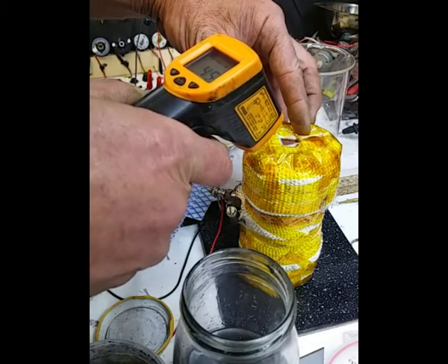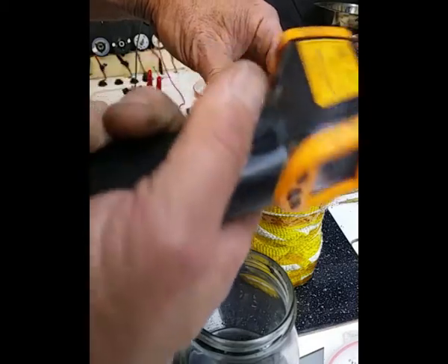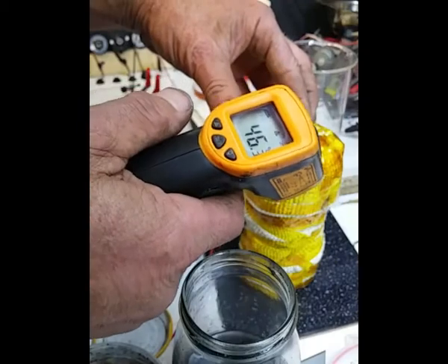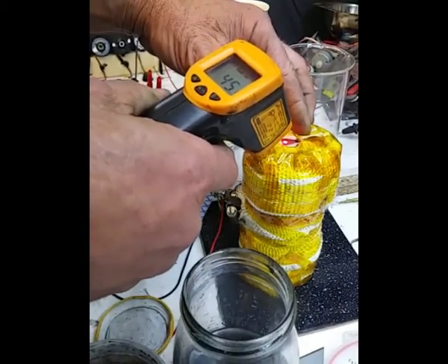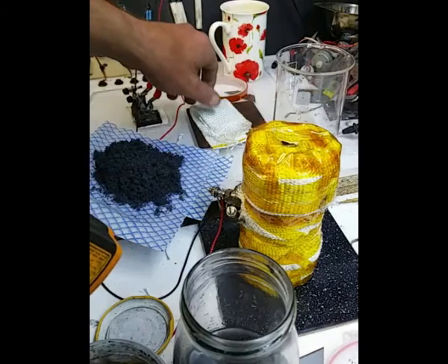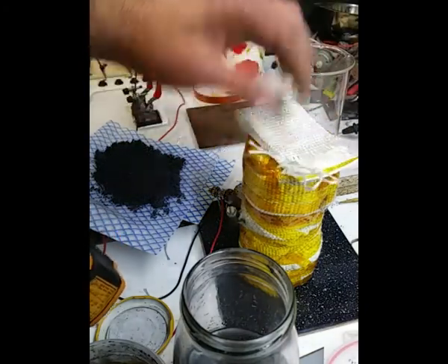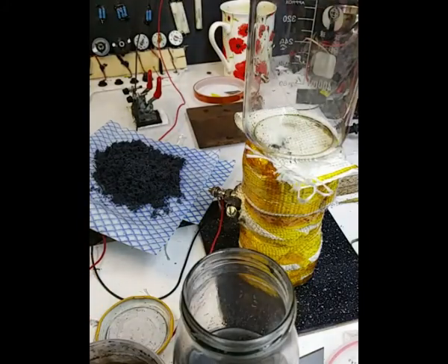So, I never really know how to use these things, whether you hold the trigger and just keep watching or just press it once or what, but guess if I'd read the instructions it would tell me. Okay, that's 46 and it's been about as I say 5 or 6 minutes, so I'll just leave that.